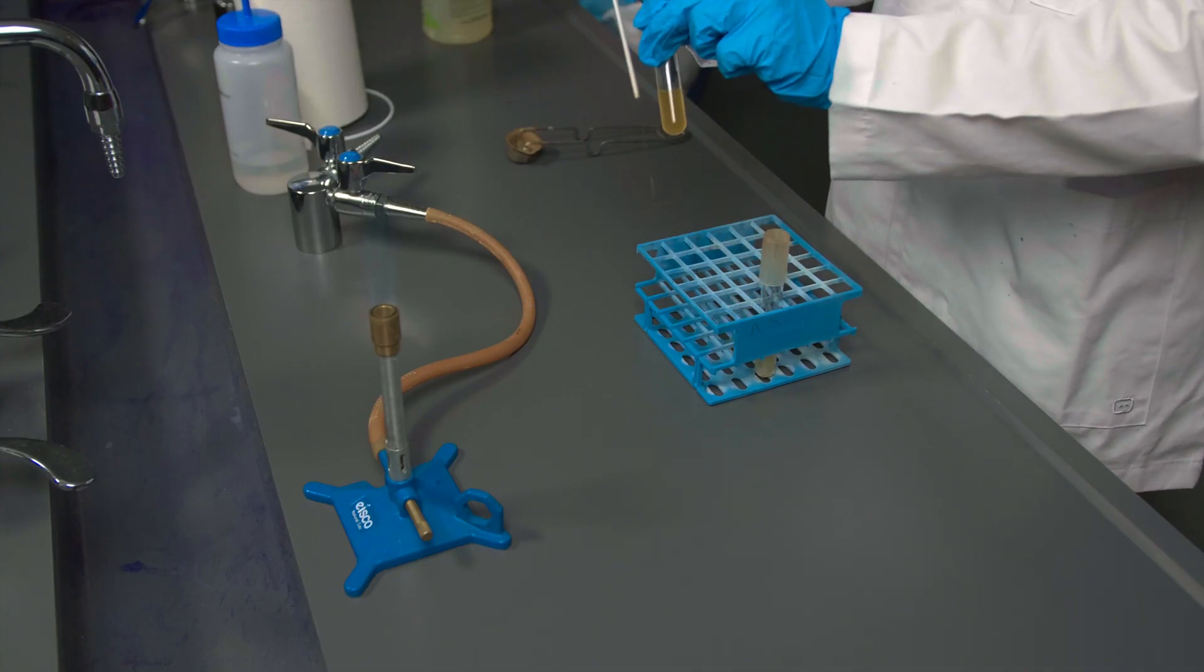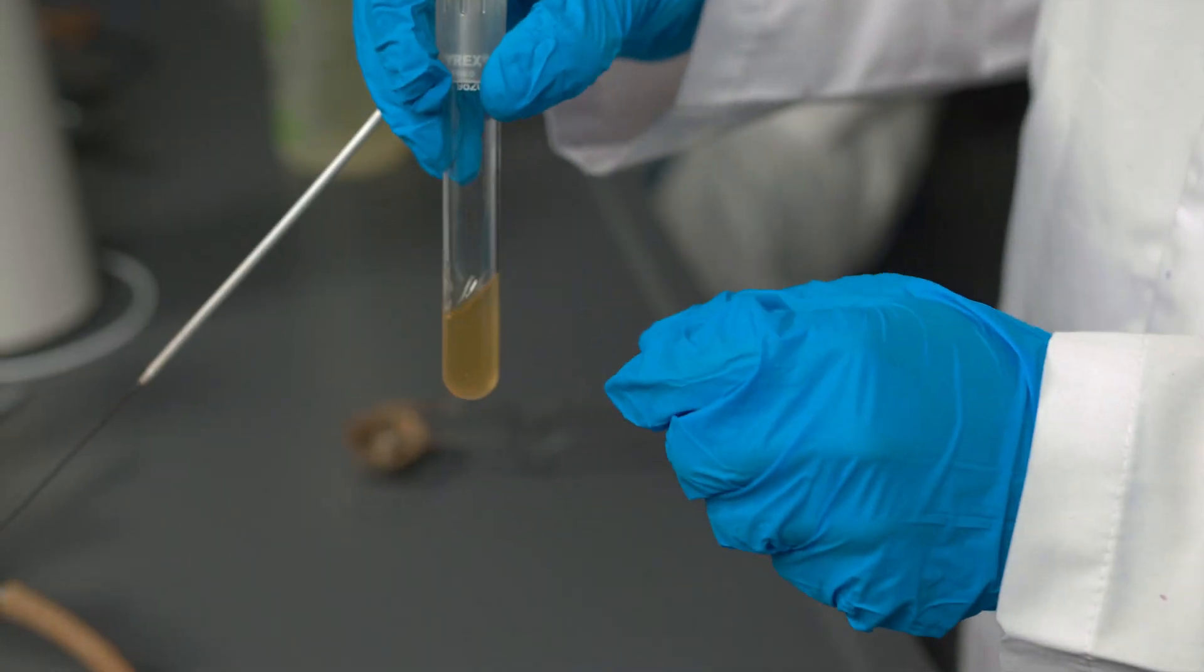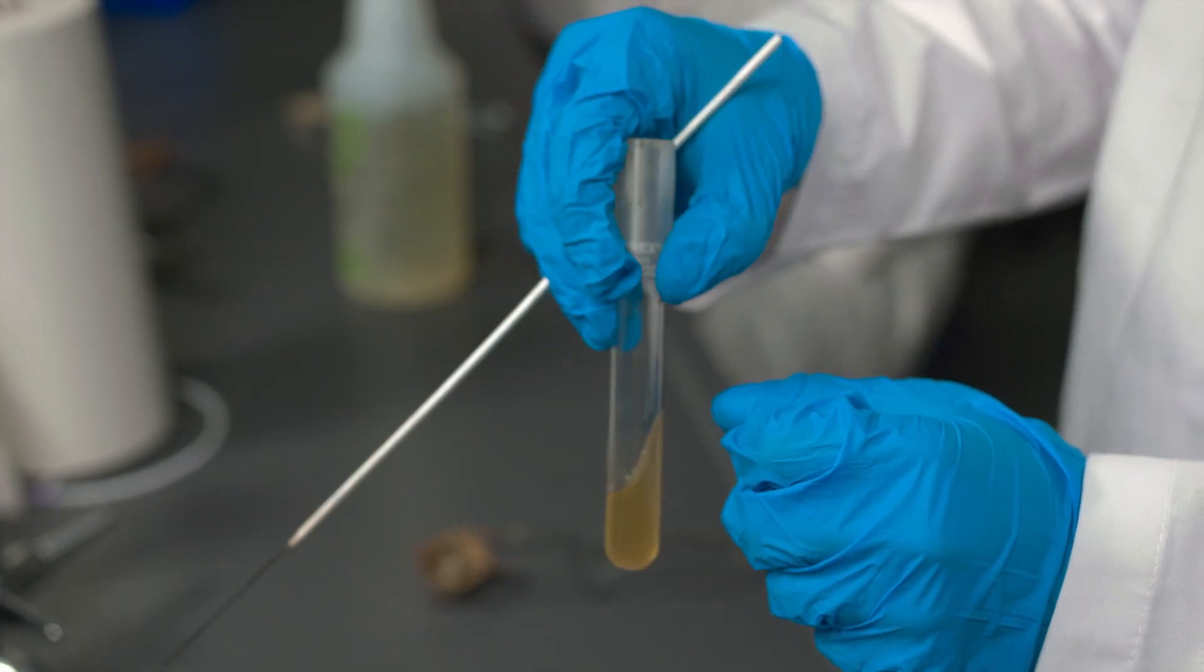Grab the broth tube with the bacteria in it. Be sure to flicker it gently to mix the bacteria solution evenly.